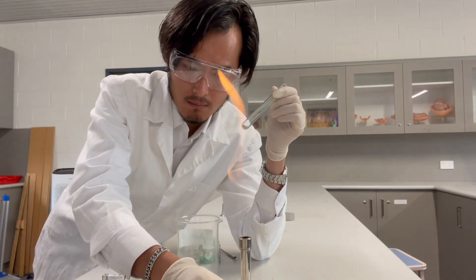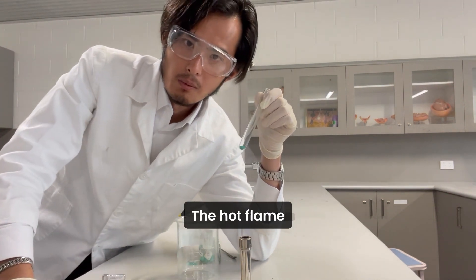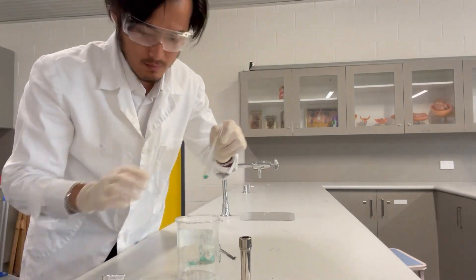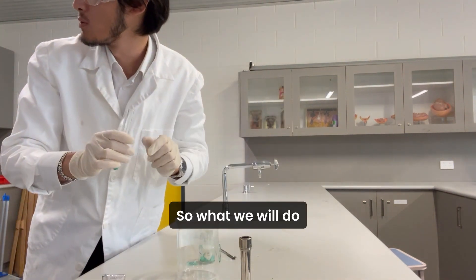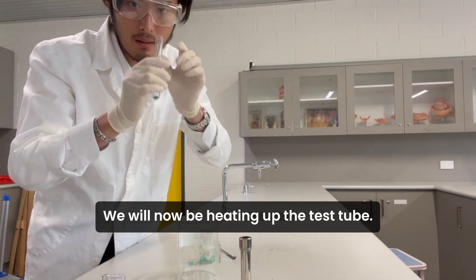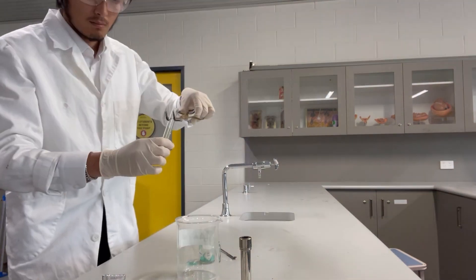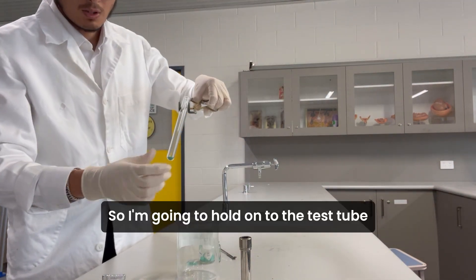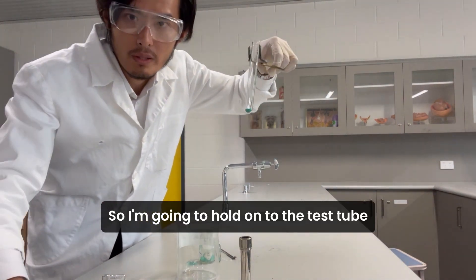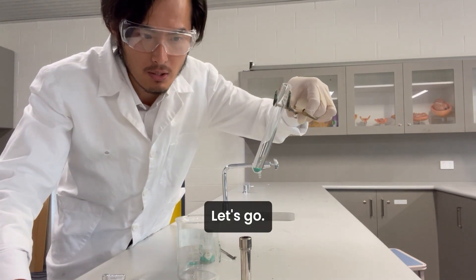We're going to make it a hot flame — it's a blue flame now. We will now be heating up the test tube. I'm going to hold on to the test tube using a test tube holder.